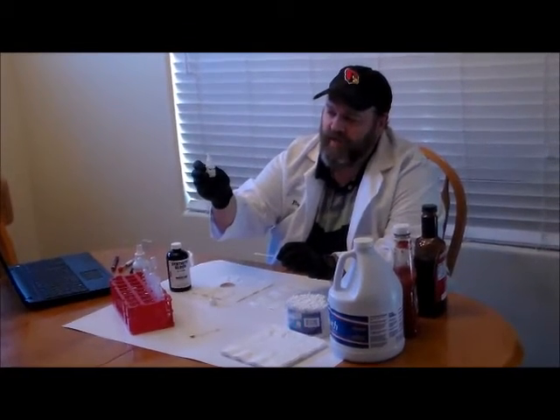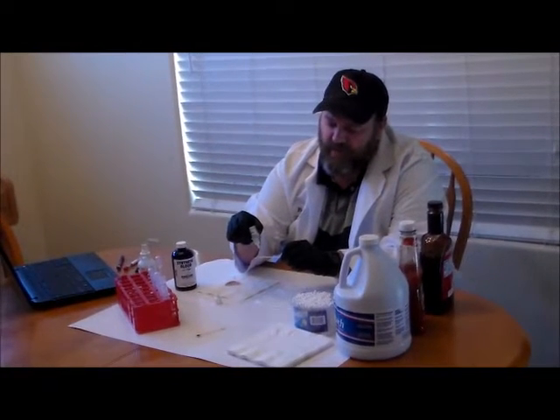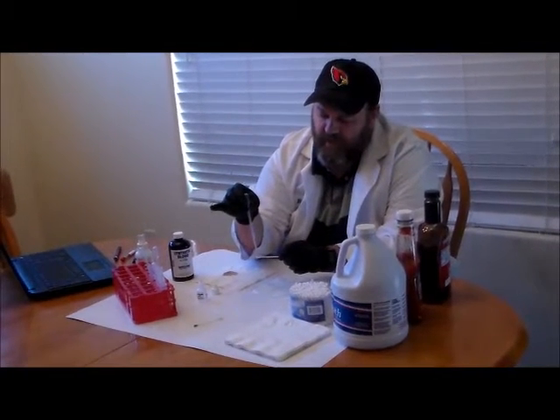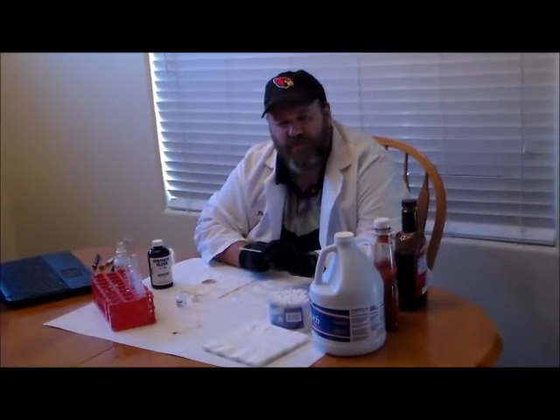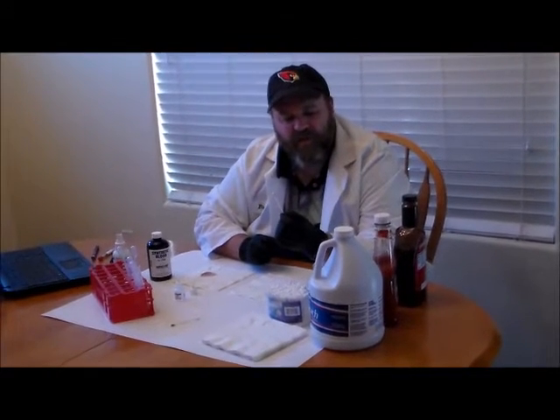I have a small bottle of ethyl alcohol here. If your vial doesn't have a dropper on the end, simply use one of your transfer pipettes to add one or two drops of ethyl alcohol to the end. Now I'm going to add one or two drops of the phenolphthalein reagent and wait to see if I get a reaction. The reaction we're looking for is a deepish, almost pink-purple color. Usually it reacts fairly quickly — and we can see it's starting to react now. A deep pink, almost purple color is a positive reaction for the presence of blood.